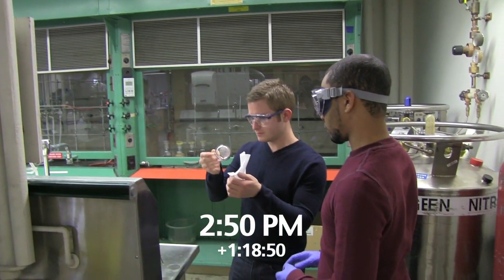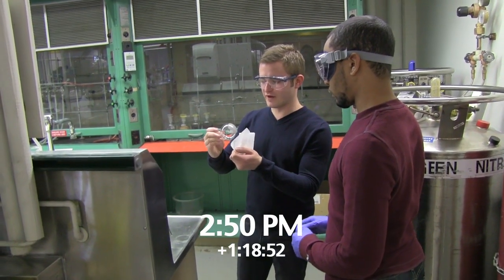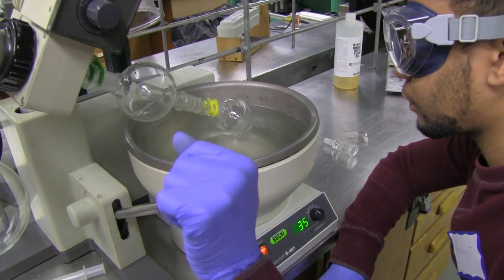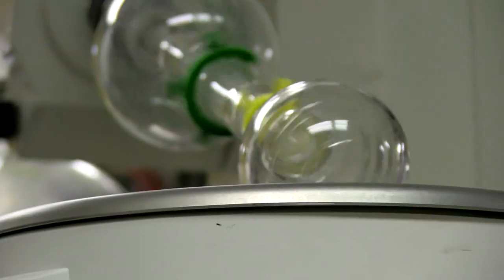Anthony's troubles finally get Phil's attention. I've put it on one of the other roto-vaps. Phil thinks the roto-vap Anthony is using must be broken.